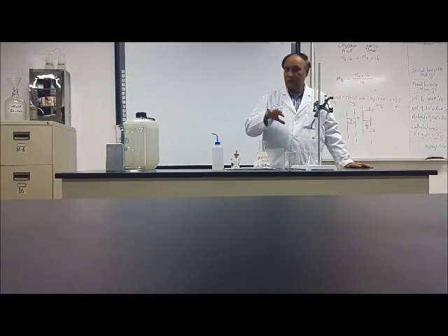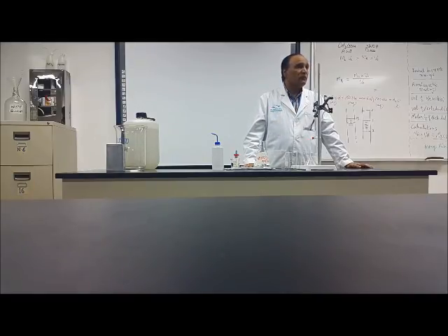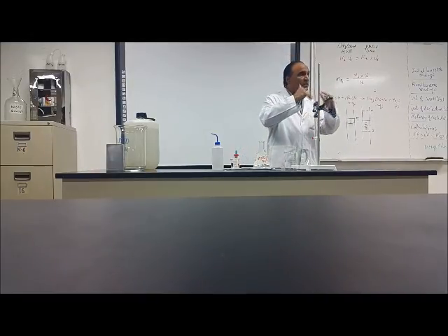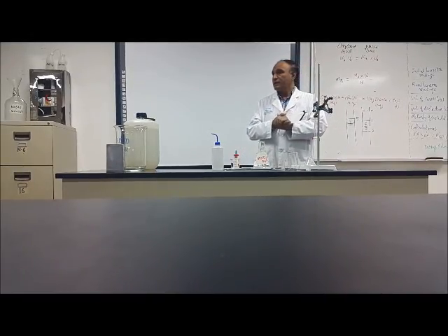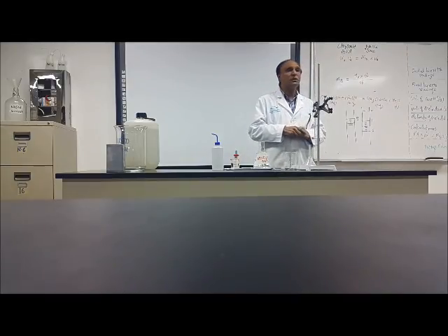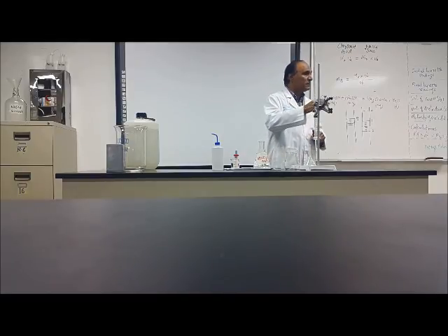Today I have made it very simple for you. When you understand this, later you can do the difficult, complicated types of titration. But today, just because you are doing it for the first time, it is simple for you.